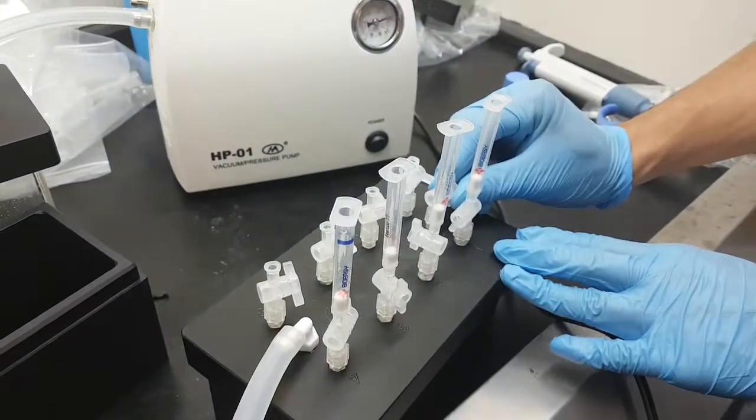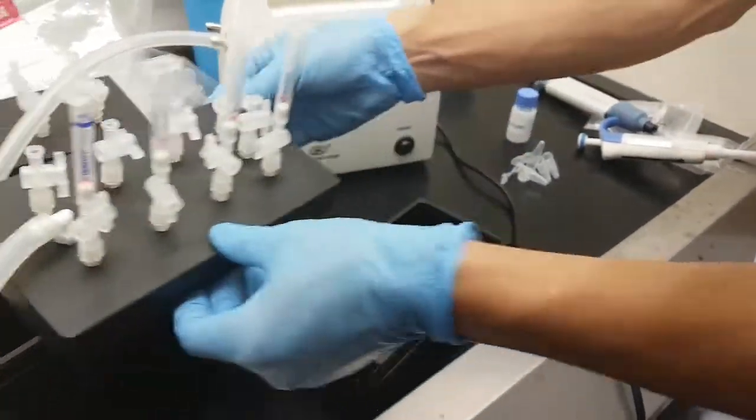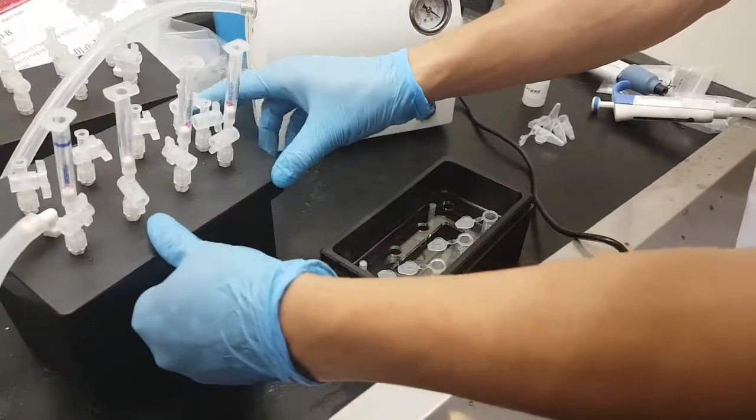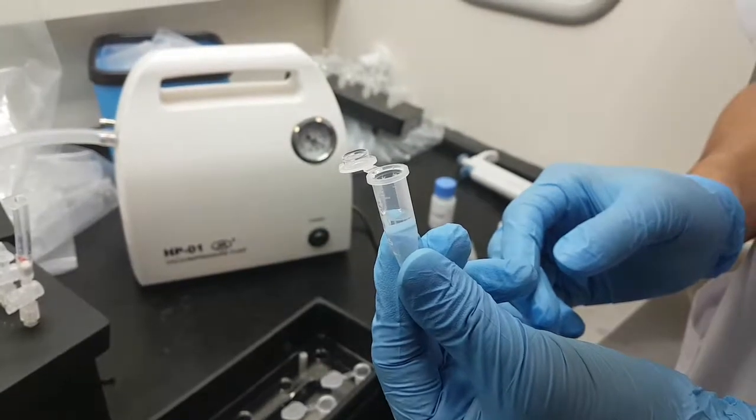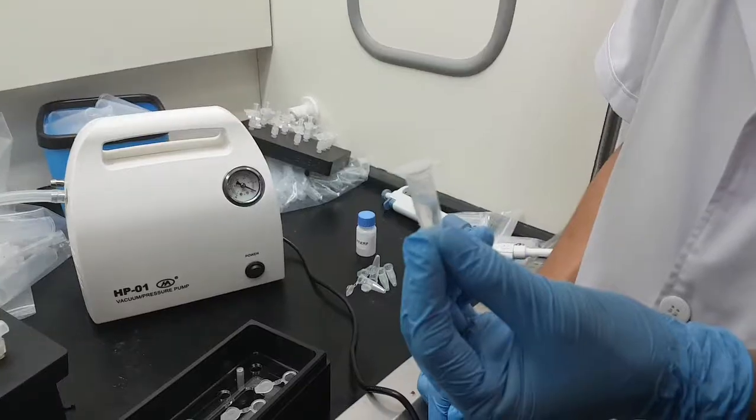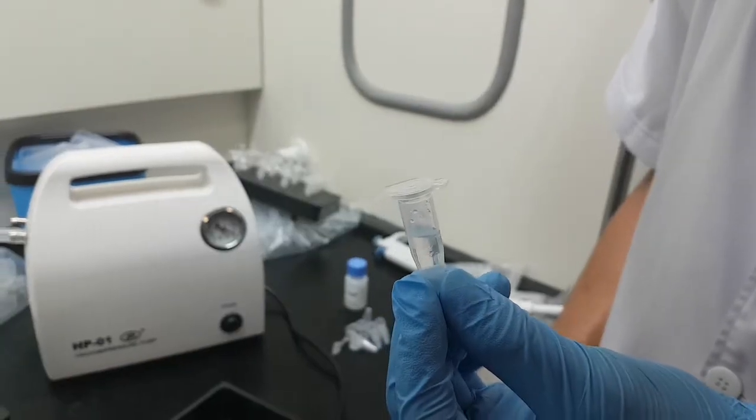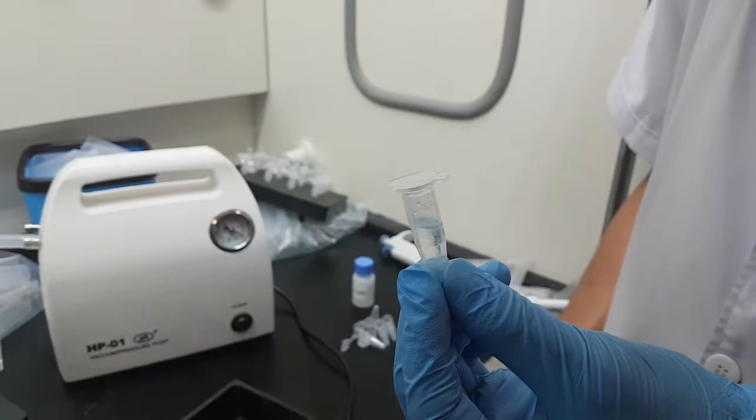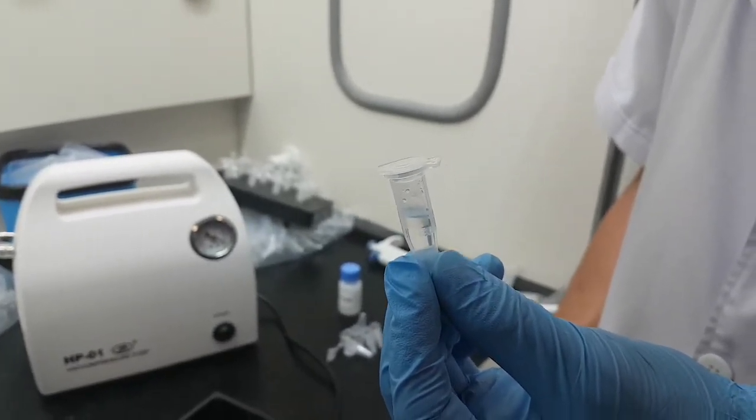Release the pressure and remove the cap. What we have here is our detection sample. The detection sample reagent can be used for detection of AOZ, AHD, SEM, and AMOZ.